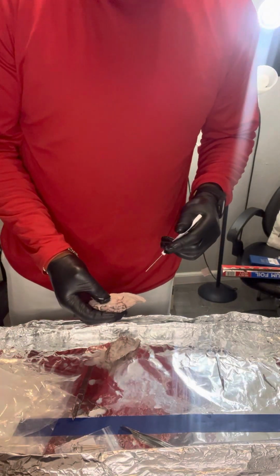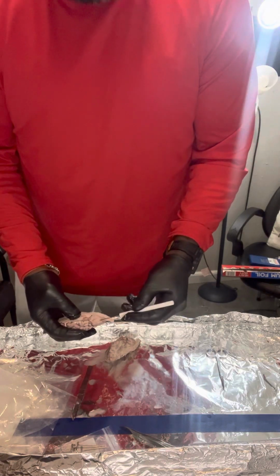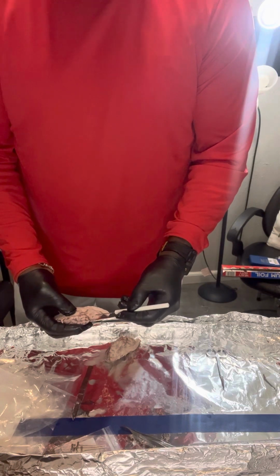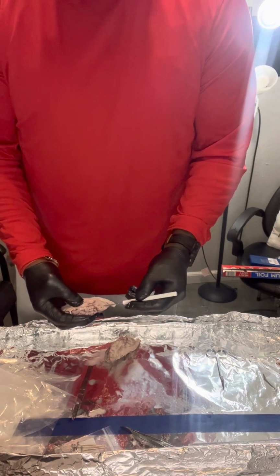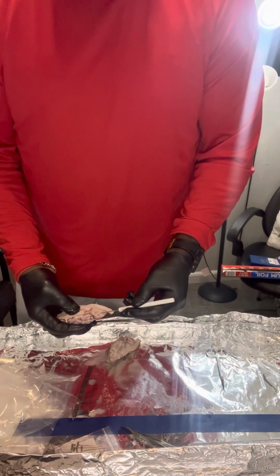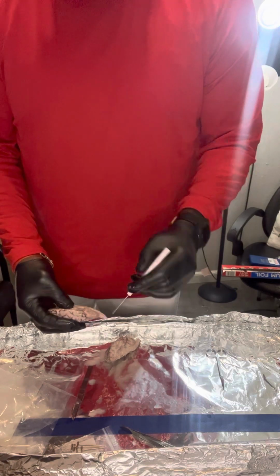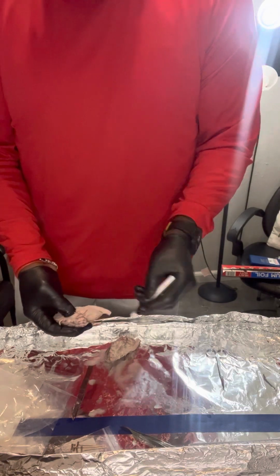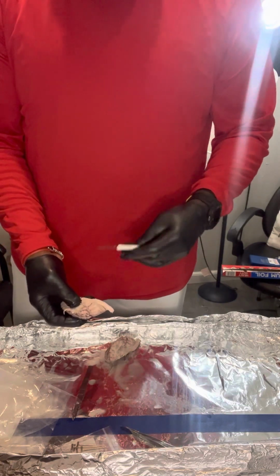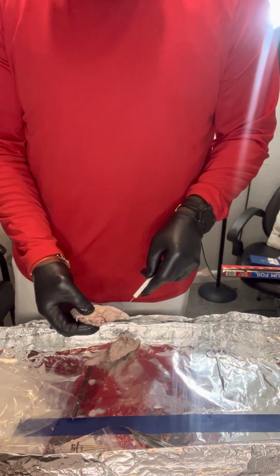Okay, the arbor vitae. Arbor vitae, that's the white texture that is located inside the cerebellum. Basically it's white brain matter. It brings sensory and motor information to and from the cerebellum. So it networks and communicates. The spinal cord, which is right here, carries messages back and forth between the brain and the nerves that run throughout the body. That is the spinal cord.